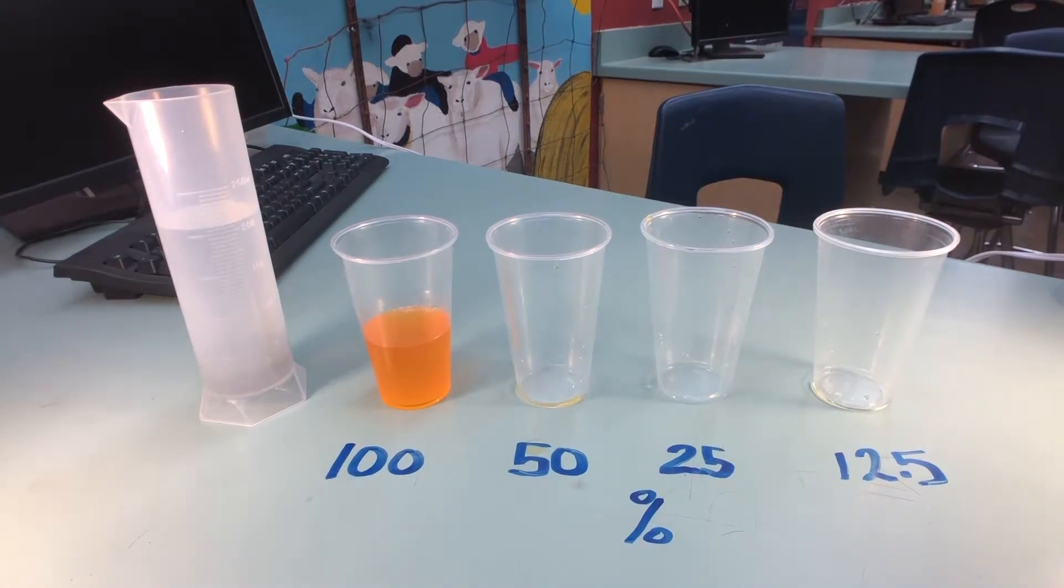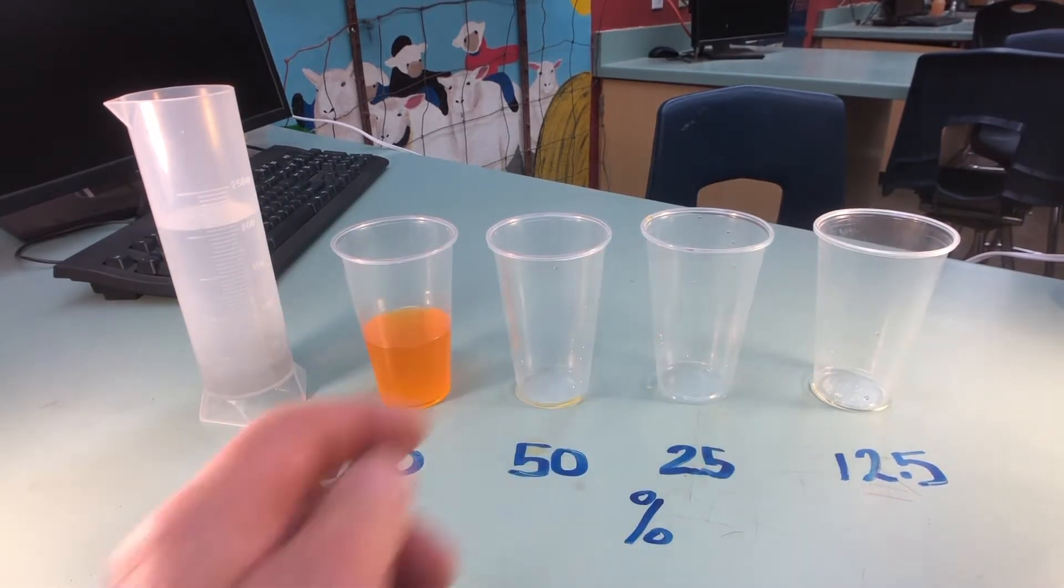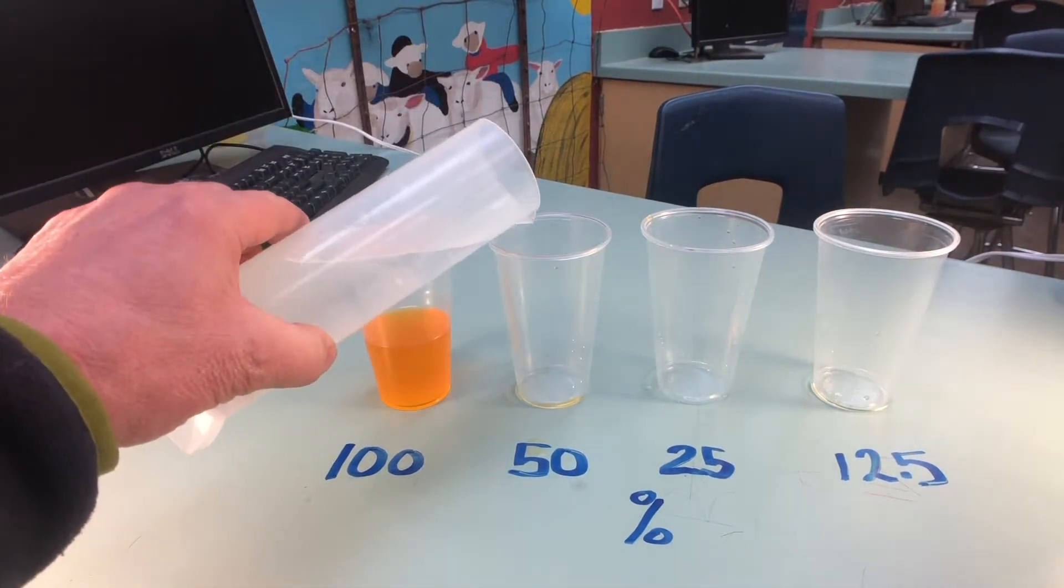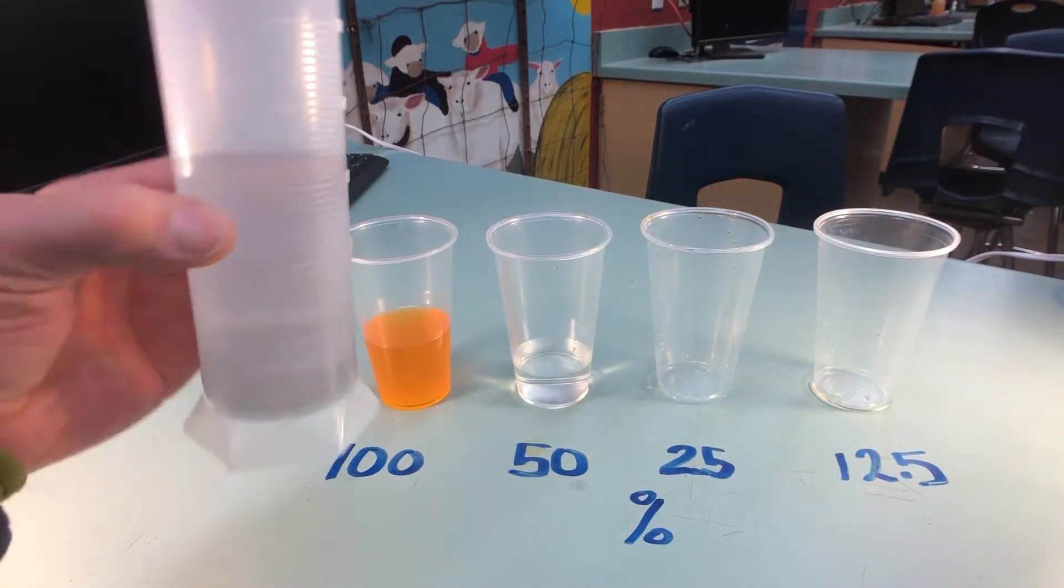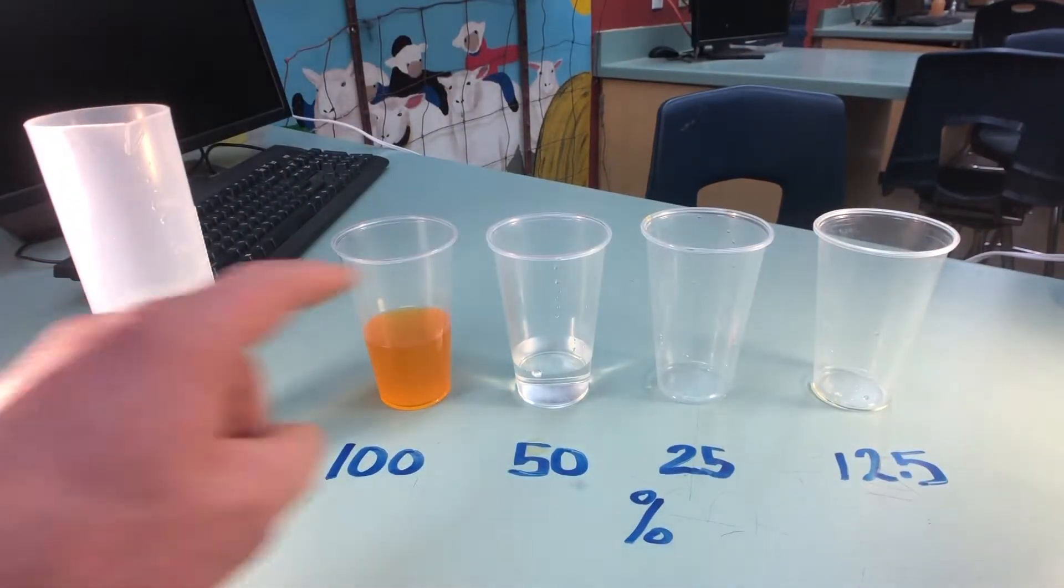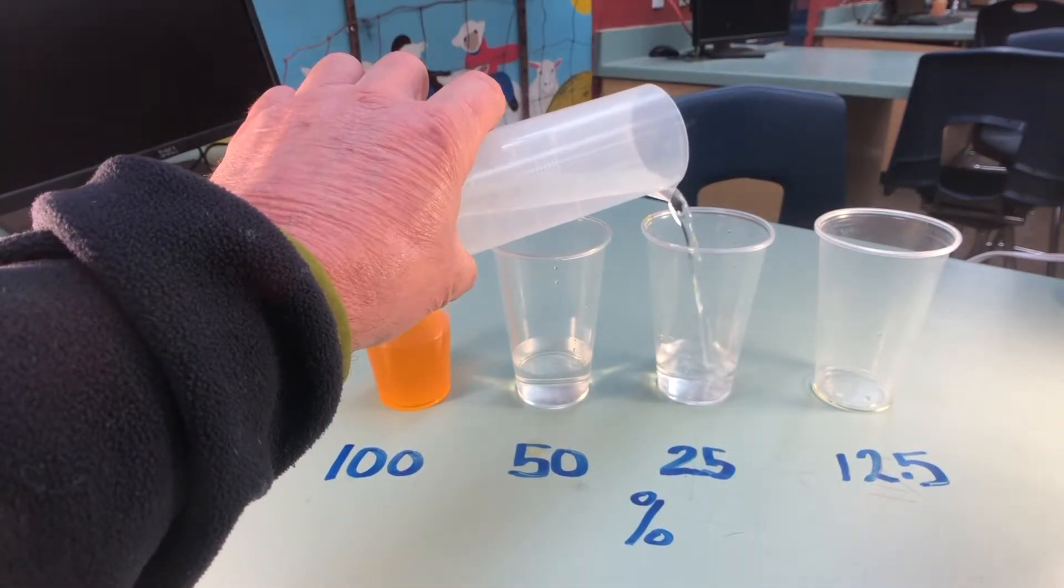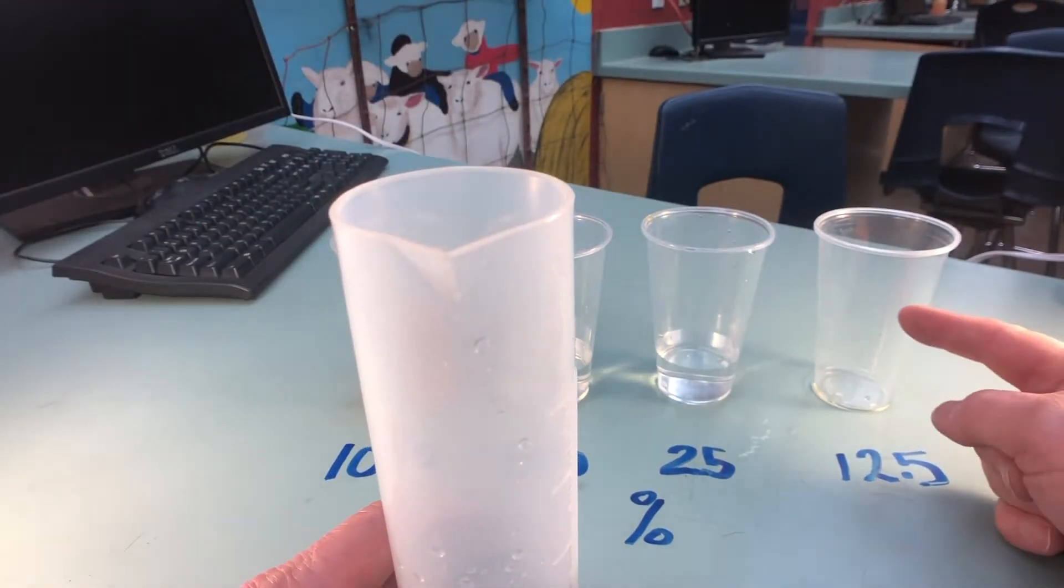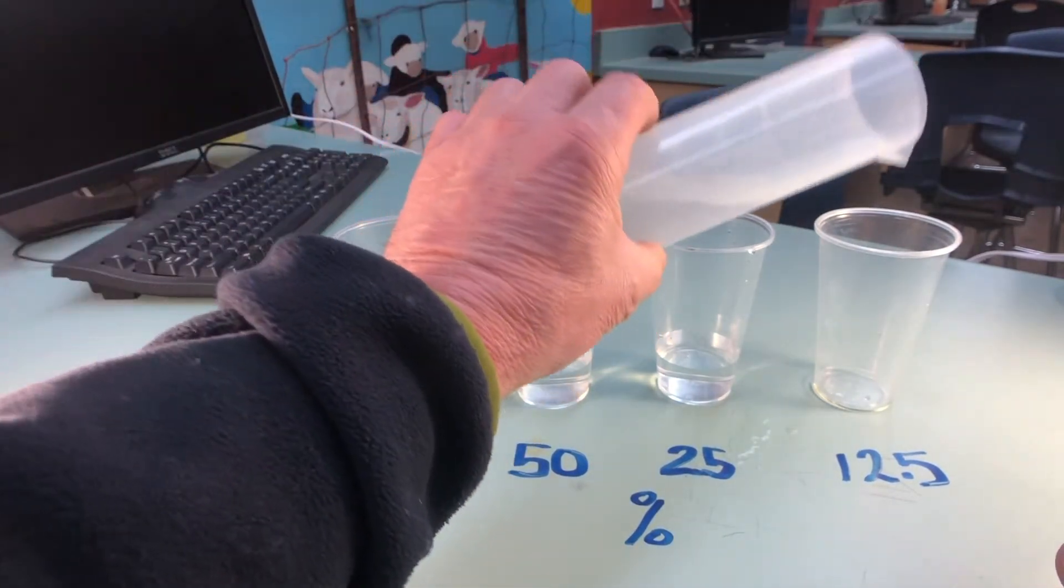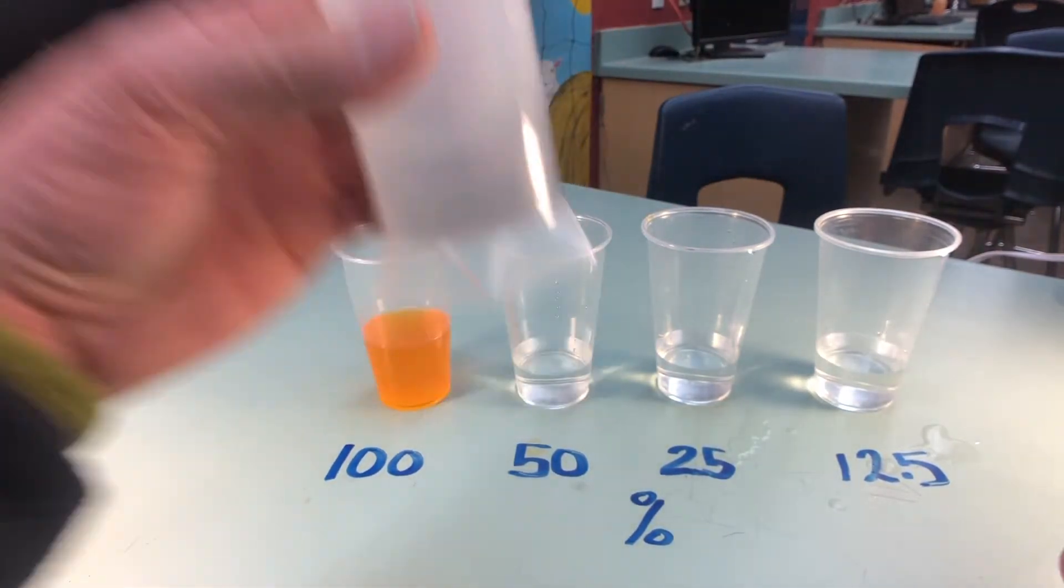Make sure we get all that out of there. And then what we're going to be doing is taking 50% of each of those. We're going to first of all put that water in each one of those cups at 50 ml's. So to start off with that I'm going to put 50 ml's right in there. And then I'm going to just check to make sure that it's right up to the level that it needs to be. And once I'm satisfied with that I'm going to set it off to the side. And we're going to then take another 50 ml's and put in the 25% cup. And keep on checking it to make sure it's accurate. And then lastly in the 12.5% cup we're going to be putting 50 ml's as well. And again check it to make sure it is accurate.